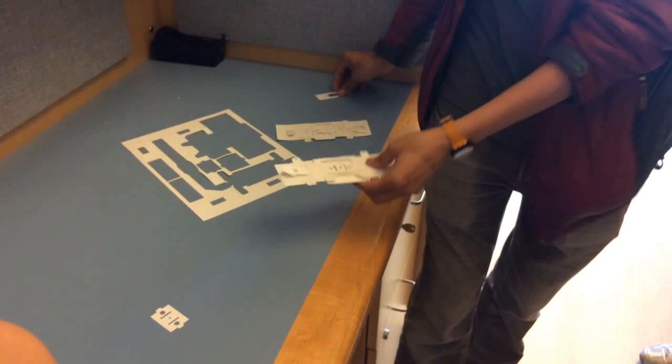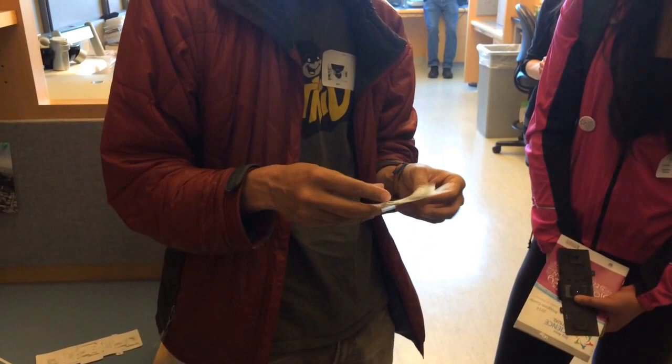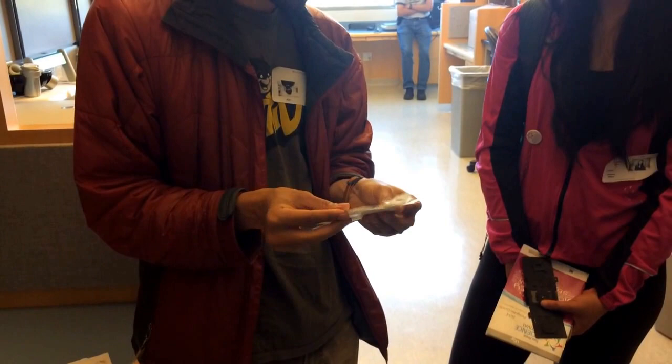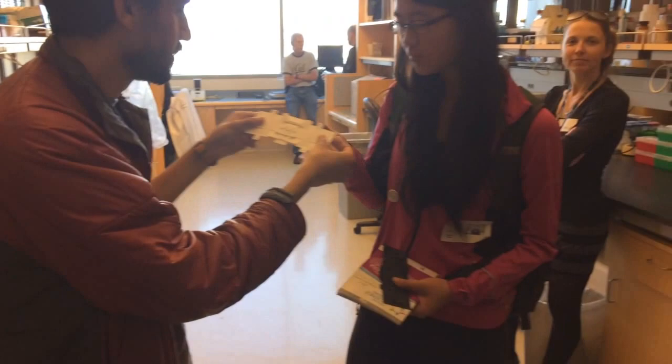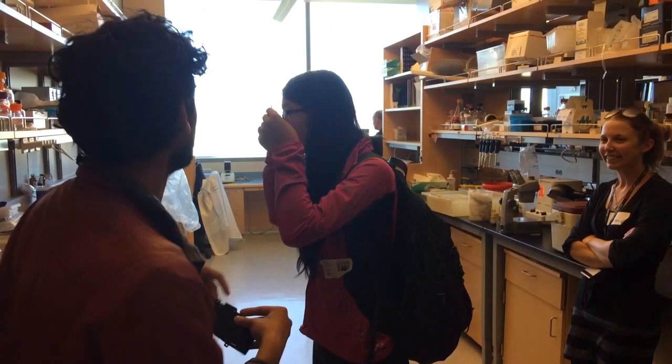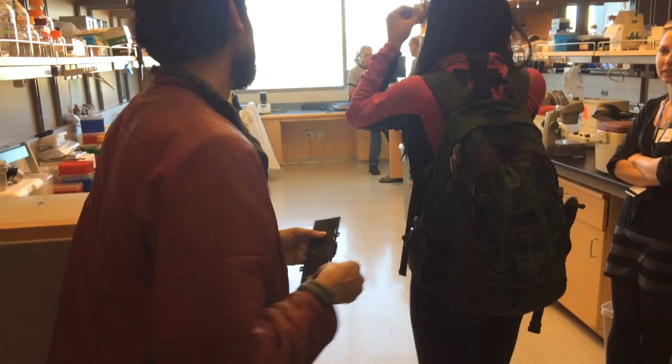But at this point, if we wanted to use this, for example, you mount the slide right there. So it fits in. And I'm going to remove this module because this is where the light comes in. And you can start using it. There you go. It's actually much better than that other scope. So if you hold that, you'll immediately see. Point it to the light. No, to that window. That's it. You'll immediately see the carbon soot sample I was talking about.